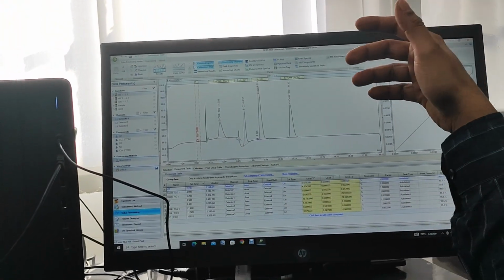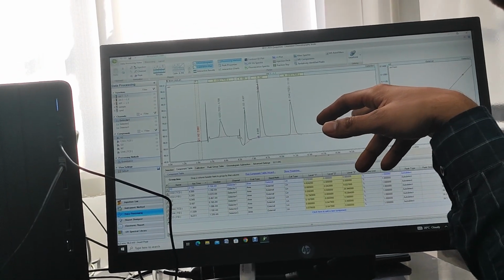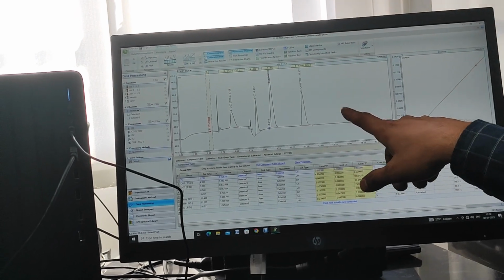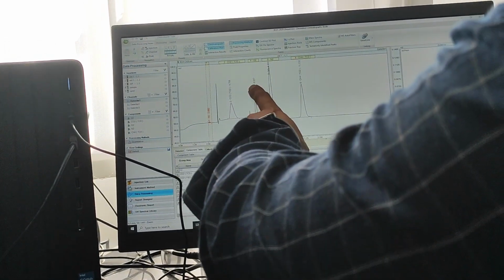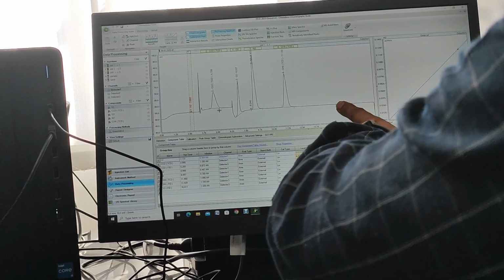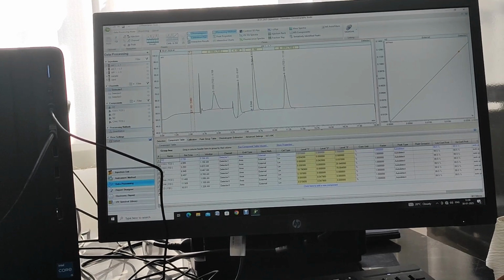There is no CO in our standard, so the CO peak is not coming, or CO is at ppm level. So here CO should come, but TCD is not detecting because it is at ppm level, maybe 100 ppm. So CO is not coming. See, oxygen, nitrogen, CH4 is there. After CH4, CO should come, right? Right? So now we will check the FID for the same component, same mixture.